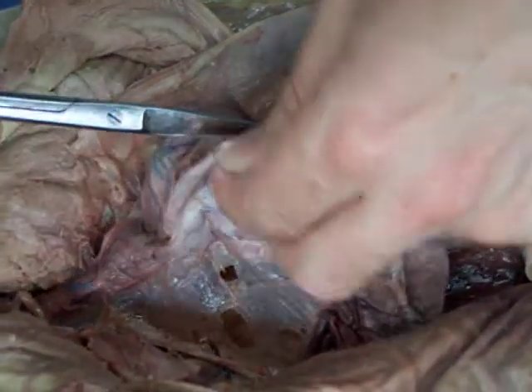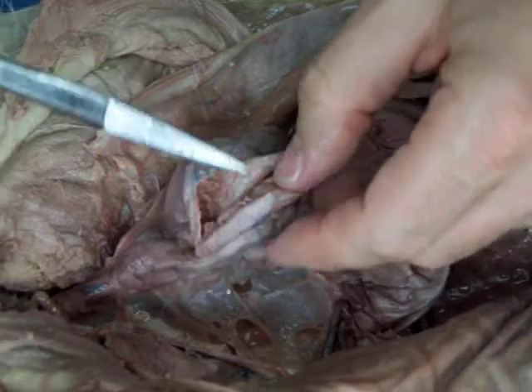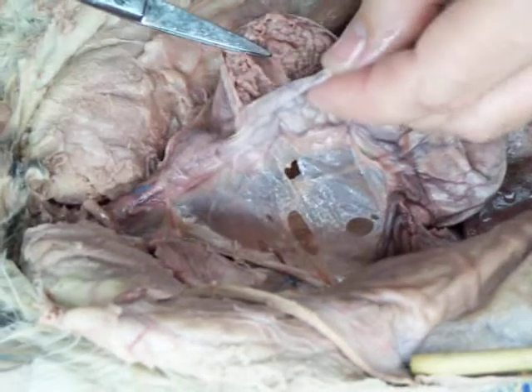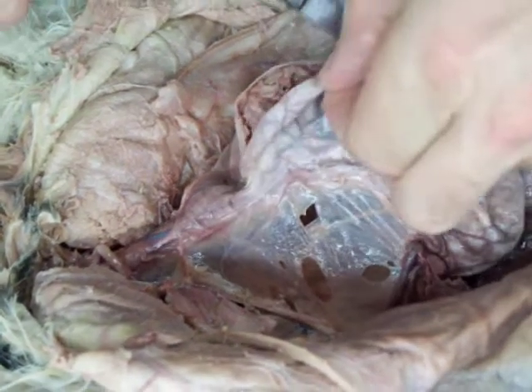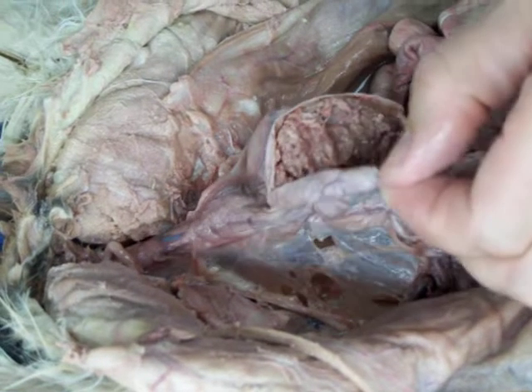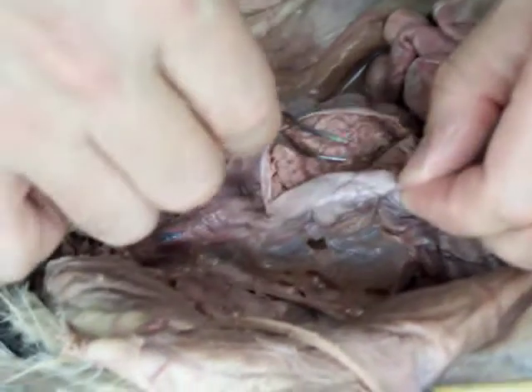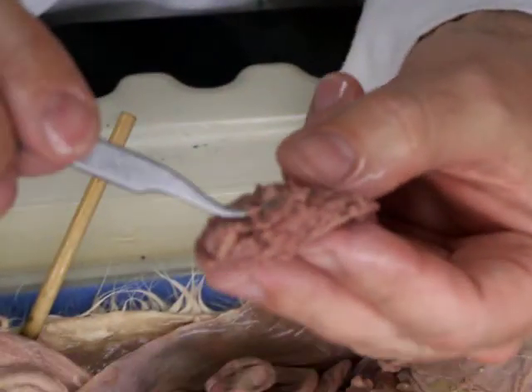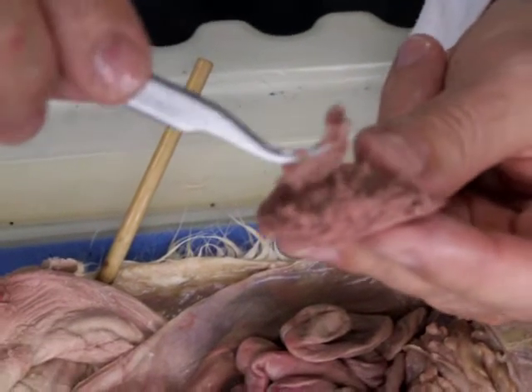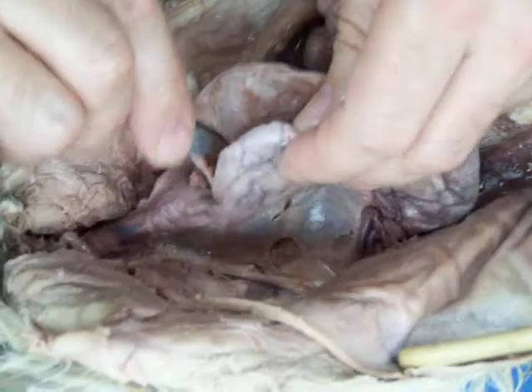You have a growth? Yeah, but ours is big too. It's just a bit thinner than pregnant. You have two right there. You see that orange thing? It's thinner. How disappointing. No little face or anything. Are they still mush? Yeah. Now there's going to be a lot of extra embryonic tissue along with them, so I'll peek. Not much. Not as cute as I thought it would be. No, none of the ones I got were really big, so.